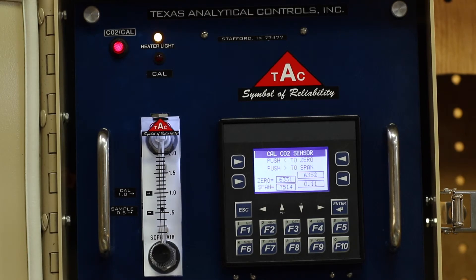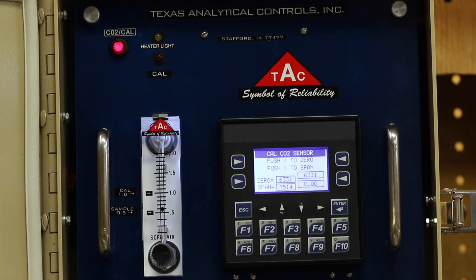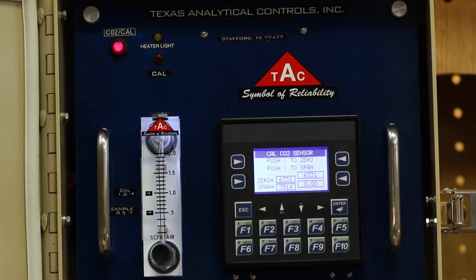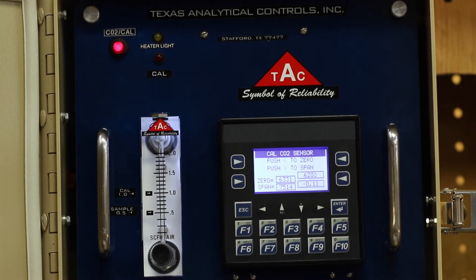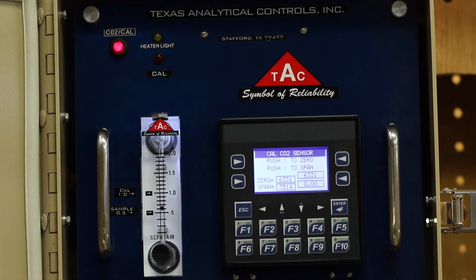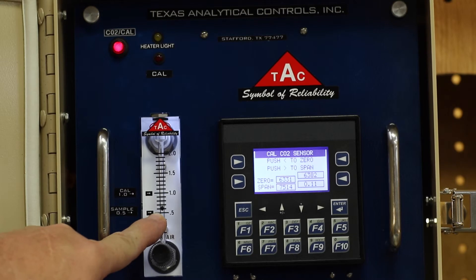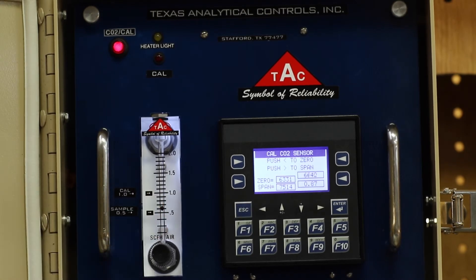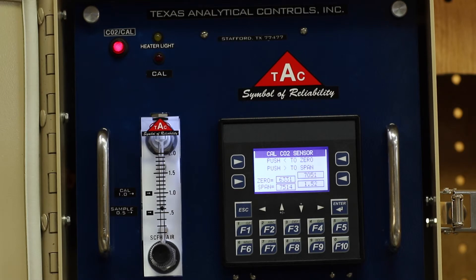Turn off the nitrogen and connect the CO2 bottle to the same standard port end. Once you have the CO2 bottle connected, go ahead and turn it on — you will note that the counts will start to climb. Make sure that you adjust the flow meter between 0.5 and 1. This will take approximately 3 minutes to stabilize.